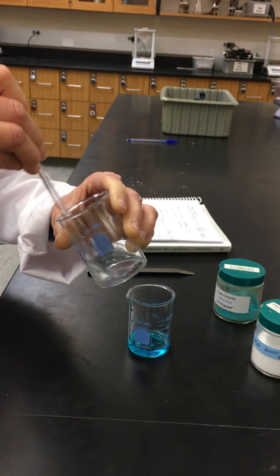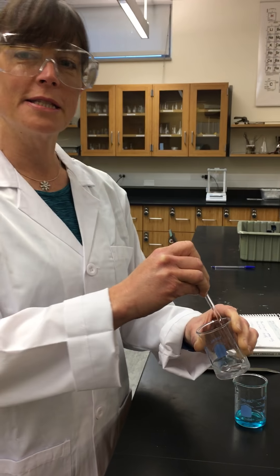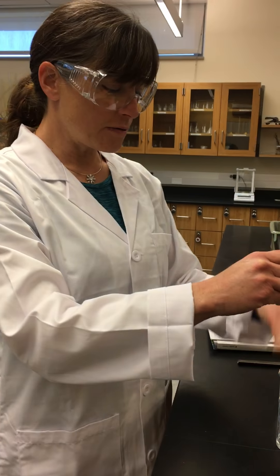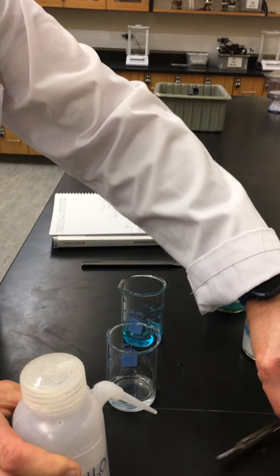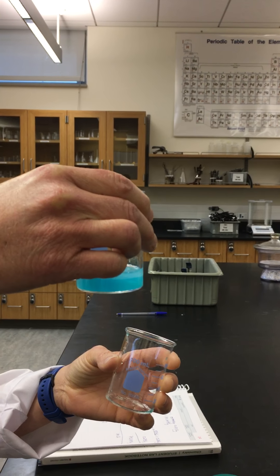We're doing an example of a double displacement reaction. The difference is that in doing a stoichiometry problem we now want to quantitatively determine the amount of product we're going to produce from this chemical reaction. Our sodium phosphate is now in solution, so we're going to mix these two solutions together. As you can see when we mix them, we formed a precipitate, which is what we're going to try to quantitatively measure at the end of the experiment.